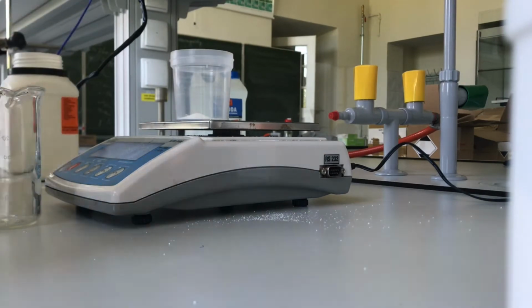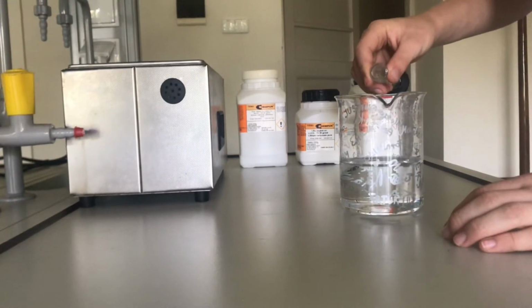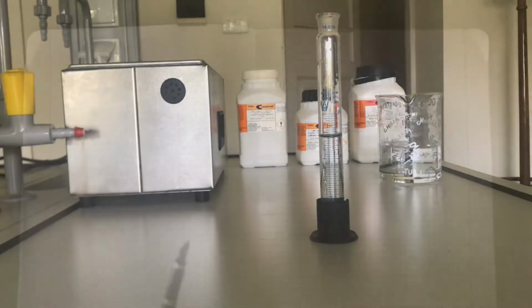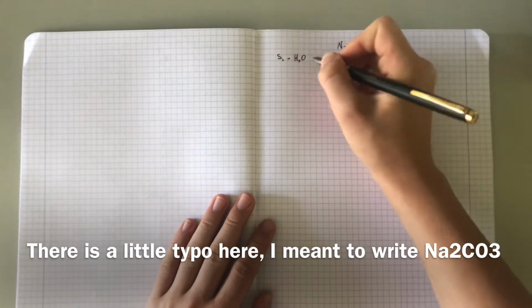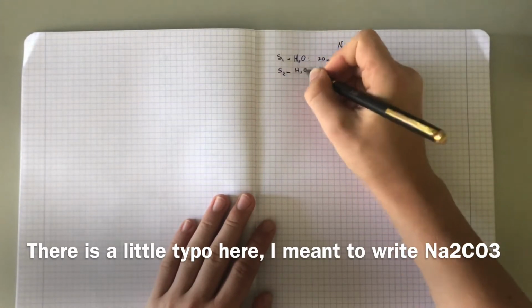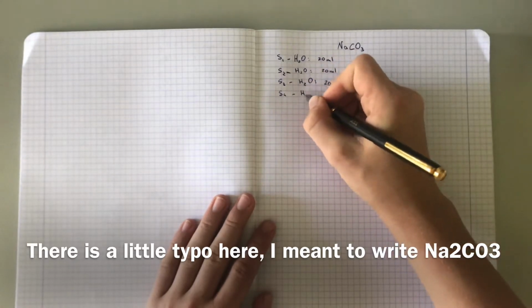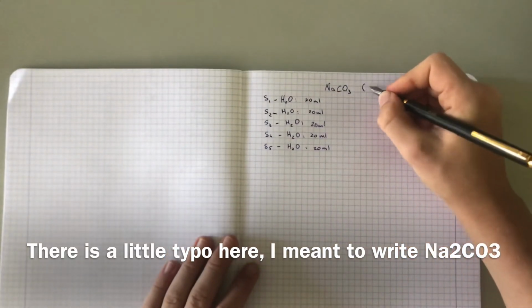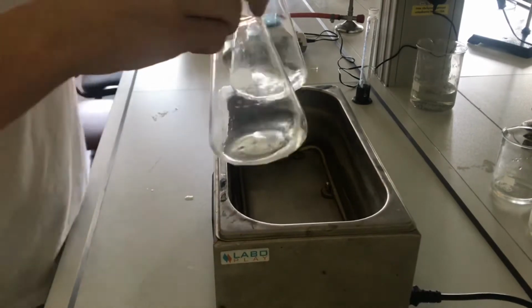As usual, I weighed my salt. Then I poured exactly 20 milliliters into a measurement cylinder. And noted the things I had done. Then, with the 20 milliliters in my vessels, I put them in a heater.